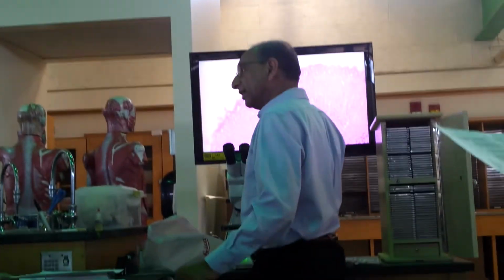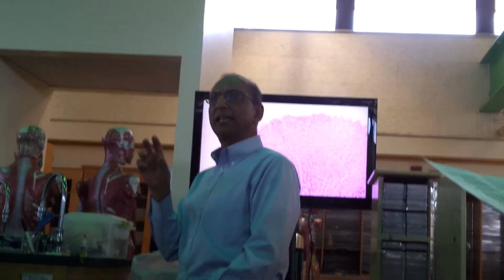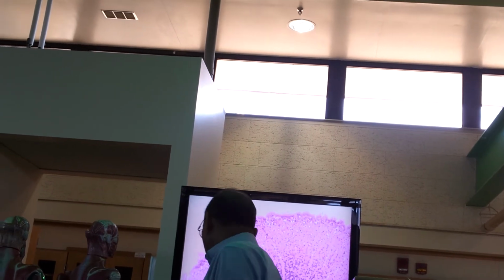Small intestine I just showed you, right? I showed you small intestine. In the small intestine, if you see many glands in the mucosa, like these glands, then this is probably more specific, but just call it small intestine. Right? Large intestine.